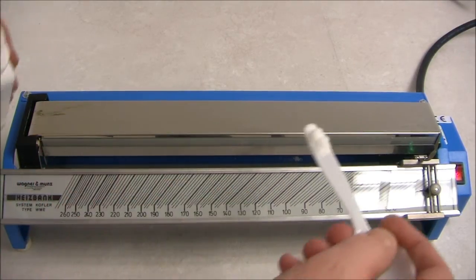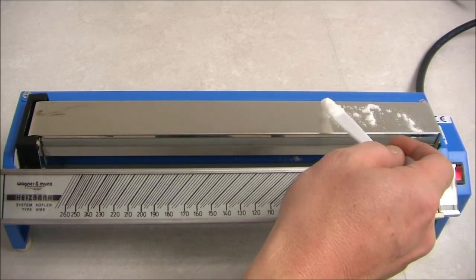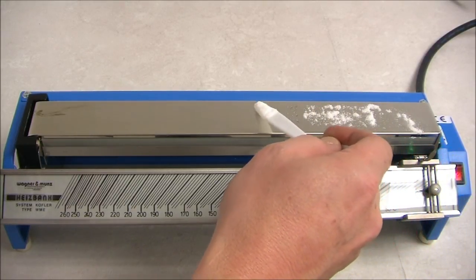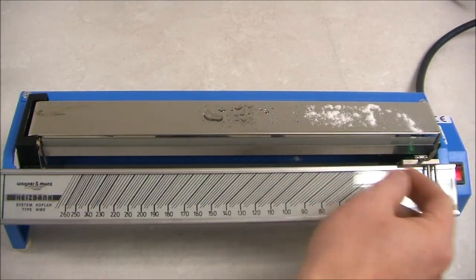You take the substance being tested and you spread it in a line along the platform. We can see it starts melting about here.